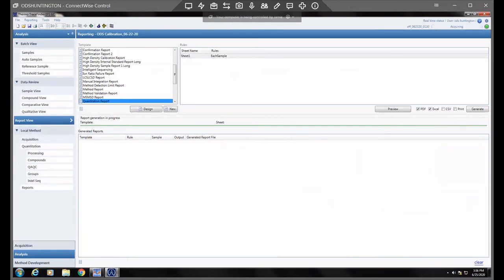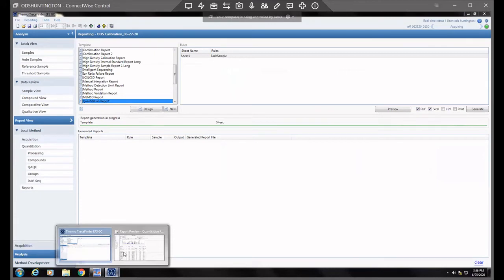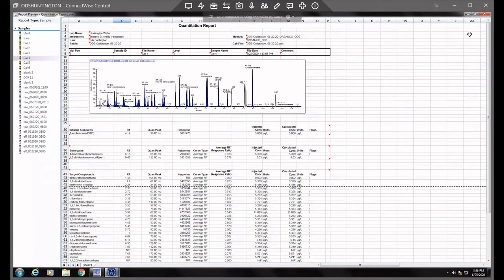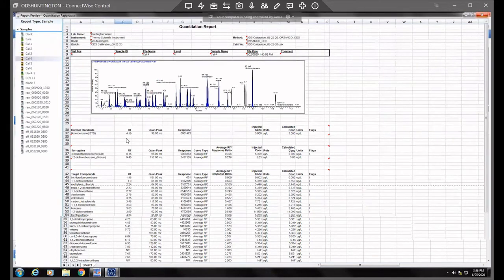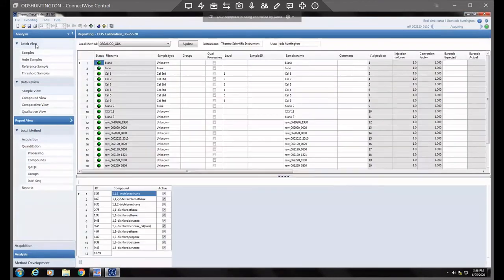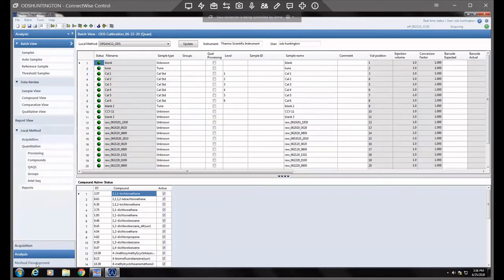Let's pull back our quantitation report here. Actually, I am mistaken. We'll close out of that one since I didn't close out of it before. What you'll actually need to do is, after you've updated your master method and saved it, go back to batch view. And when you're in batch view, there's this update button. If you just hover over it, it says update from master method.